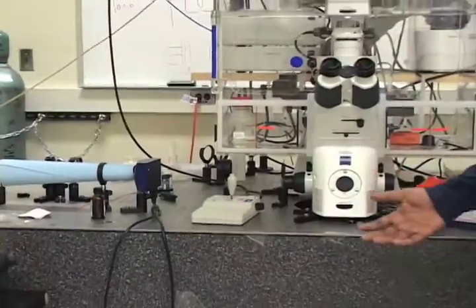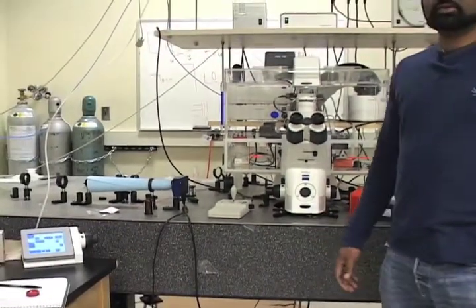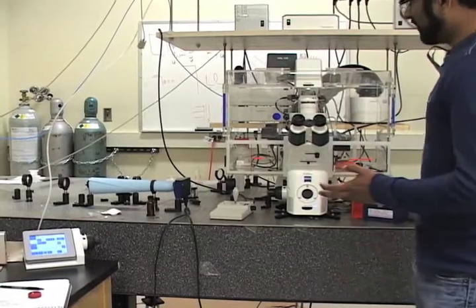So as you've already heard in the lecture, at the lab we developed several new kinds of interference microscopes, and the overall method is called quantitative phase imaging. Today I'll talk to you about the newest method to come out of our lab, which is called spatial light interference microscopy.